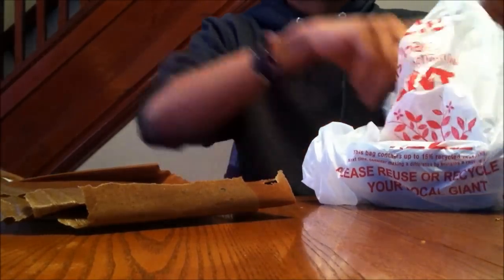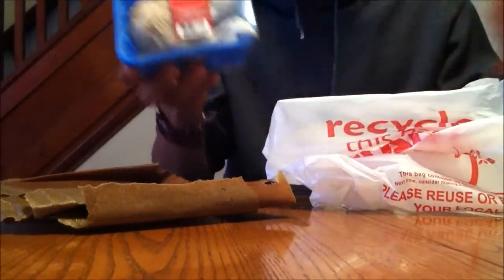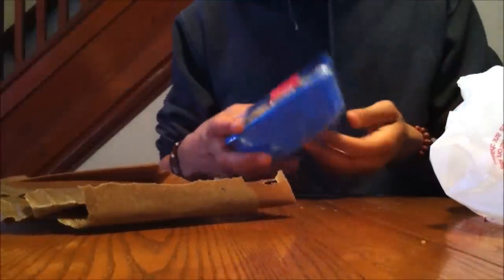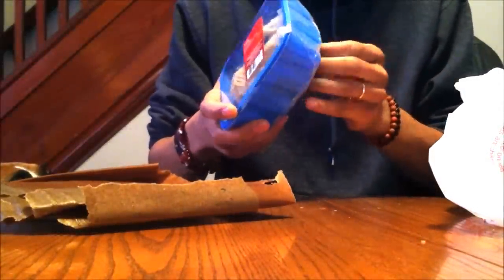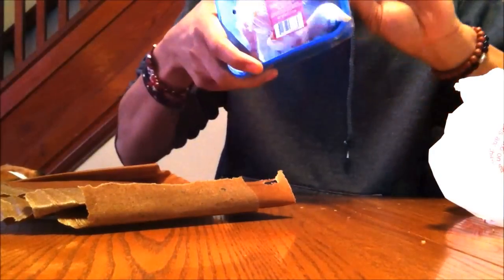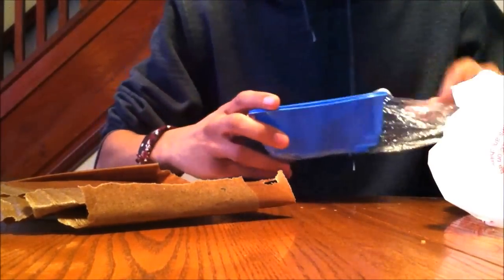We just went to our local grocery store and picked up a box of oyster mushrooms. This was $3. You could just grab some if you're going to be eating some for dinner. Anybody can do this. You can teach your little kids how to do this. It's really fun.